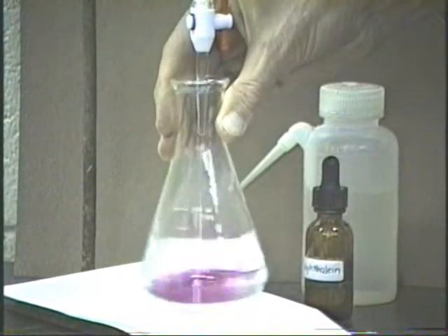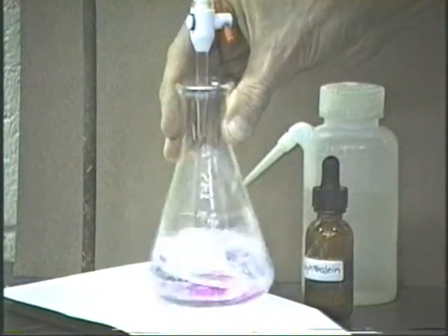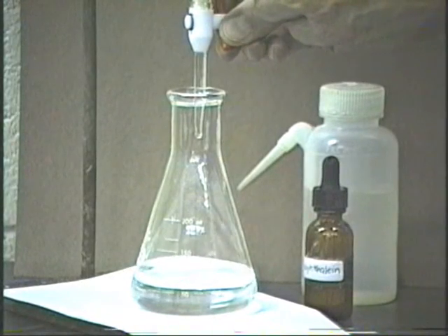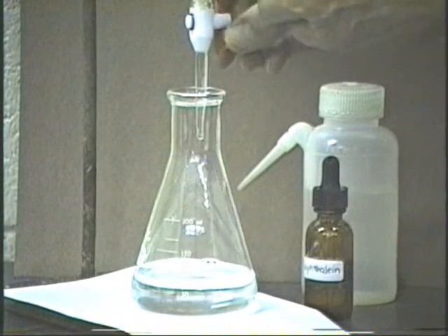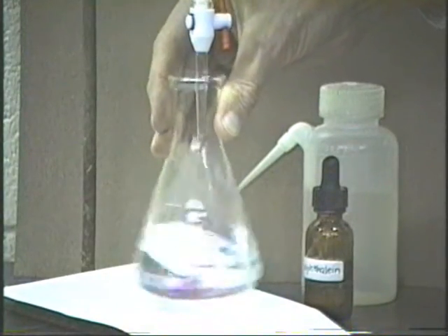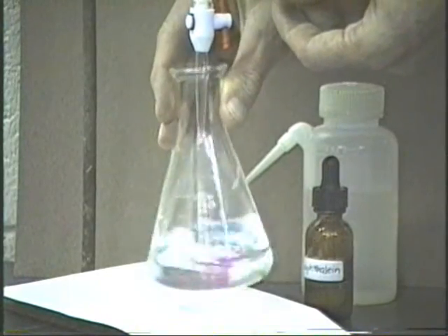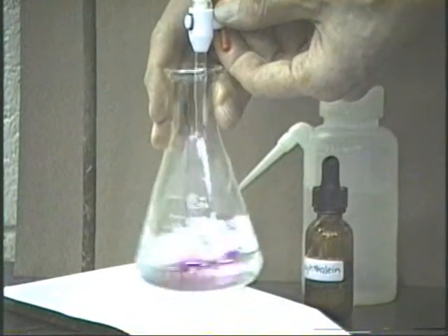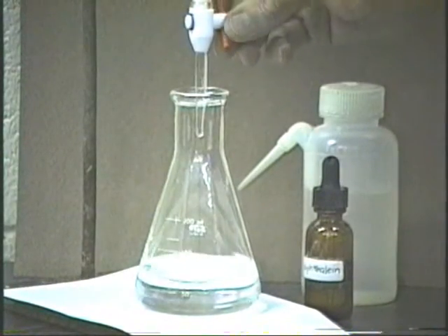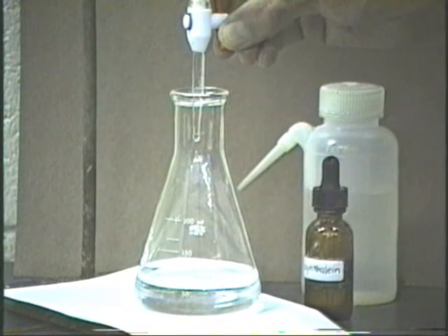Keep swirling, we can keep adding it fairly rapid. Well, now it's getting pretty big, so I think we'll stop it. We're within a milliliter or so at the end point, and we'll now start adding dropwise. So, you see now, adding at the slower rate. Pink color isn't quite as, but now it's getting big again, so we'll go even more slowly. Just stop it and just get that going just barely.